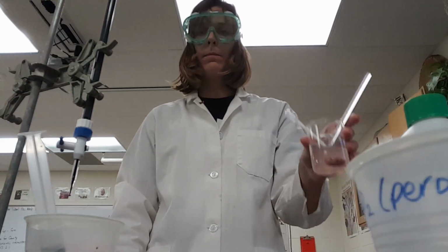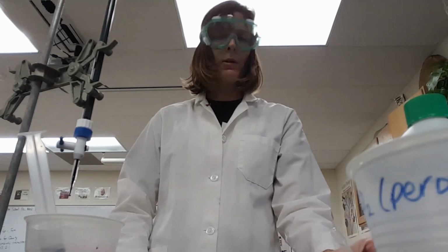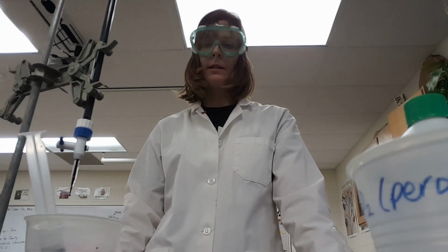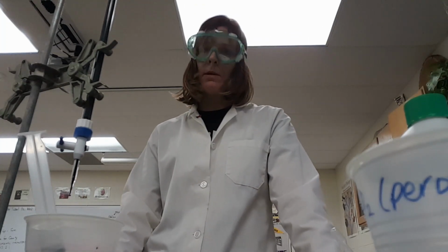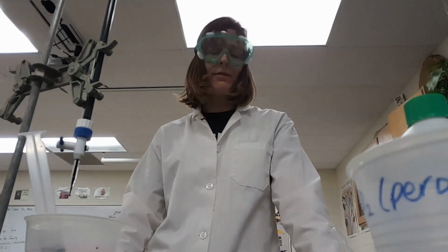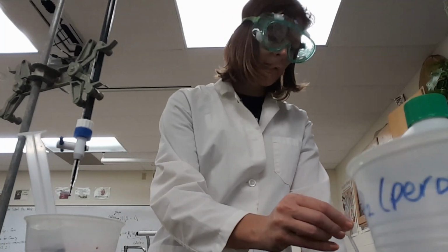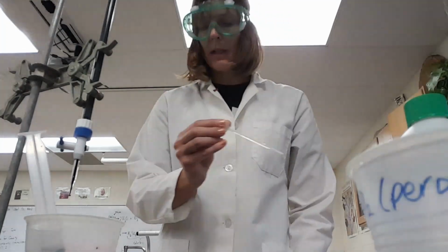The catalase, by the way, is from beef liver, but it is in really pretty much any living cells. Hydrogen peroxide is a byproduct of metabolism. It's something that is toxic, and so we have this enzyme in our cells. Supposedly you're supposed to be able to extract it from turnips and stuff like that. I tried that, didn't have very good luck, but there are recipes out there. You're supposed to be able to get it from yeast too, but the beef liver works pretty well.